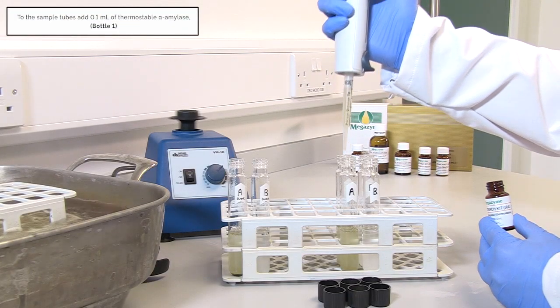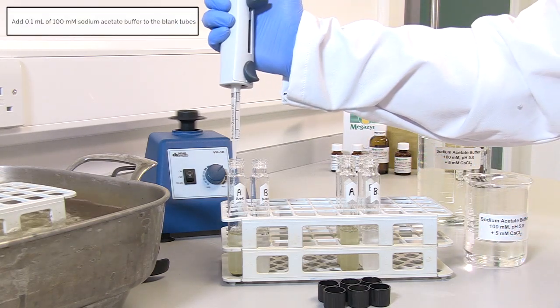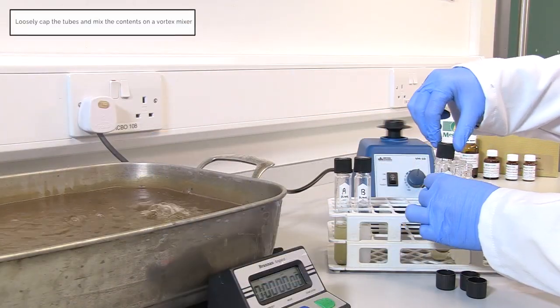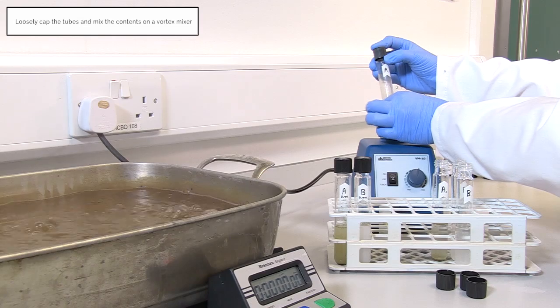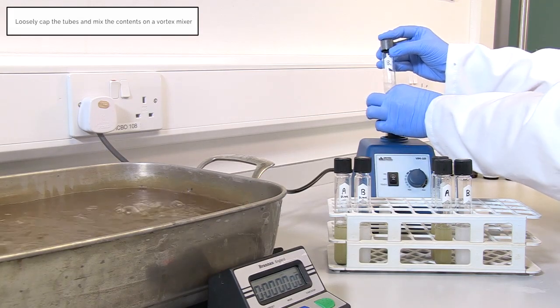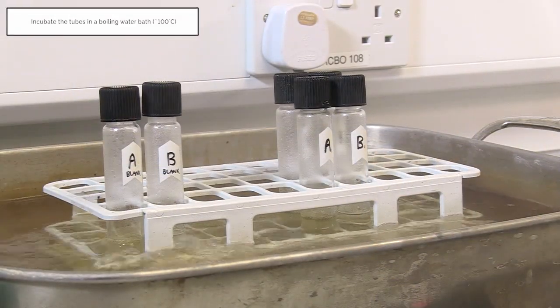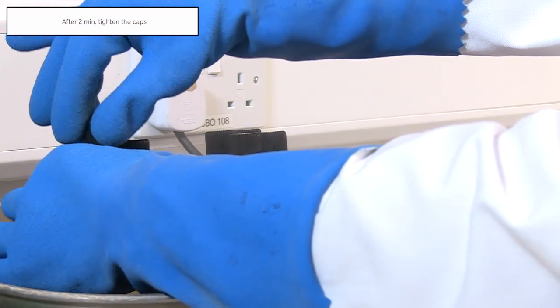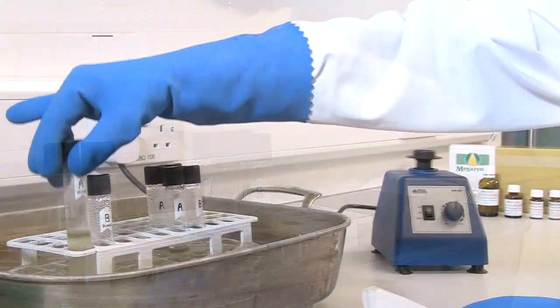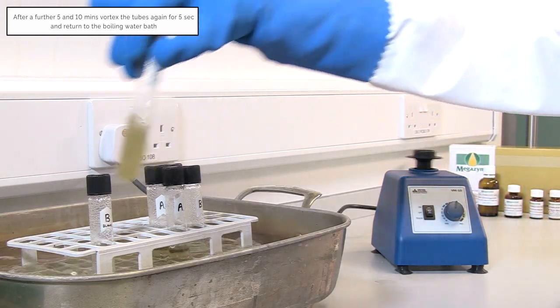To the sample tubes add 0.1 millilitres of thermostable alpha amylase. Add 0.1 millilitres of 100 millimolar sodium acetate buffer to the blank tubes. Loosely cap the tubes and mix the contents on a vortex mixer. Incubate the tubes in a boiling water bath at approximately 100 degrees Celsius. After 2 minutes tighten the caps. After a further 5 and 10 minutes, vortex the tubes again for 5 seconds and return to the boiling water bath.